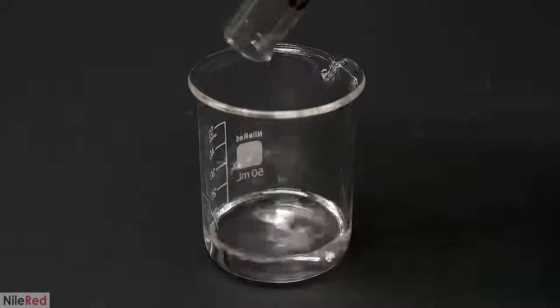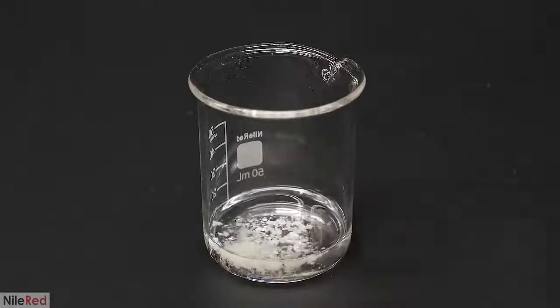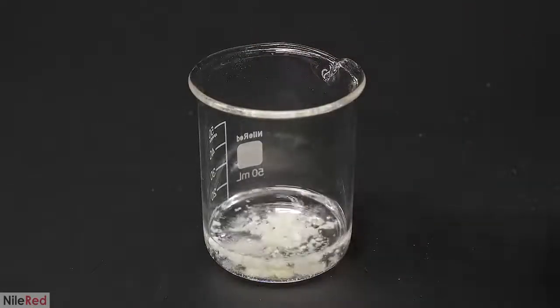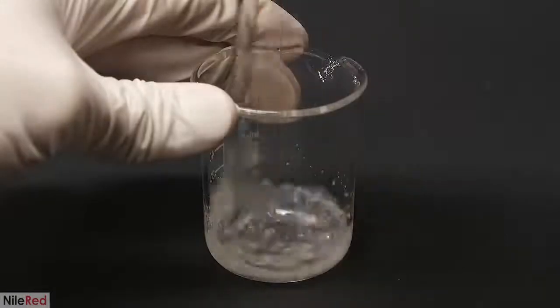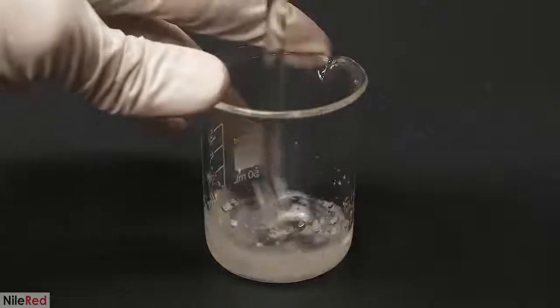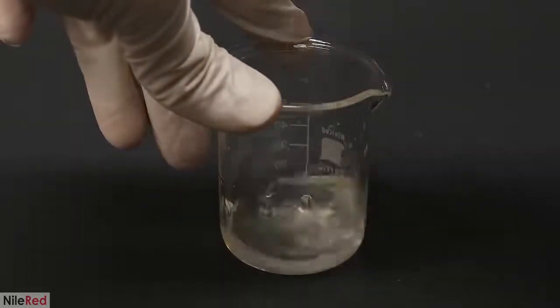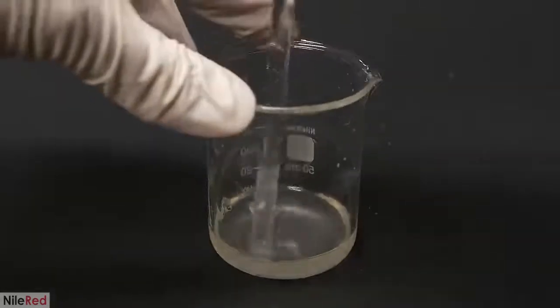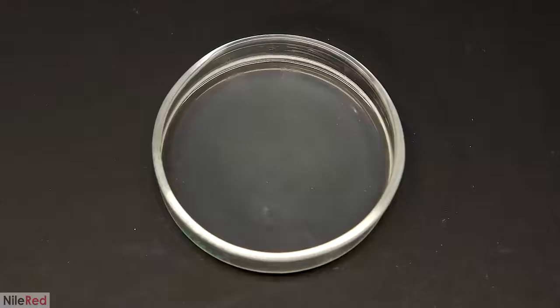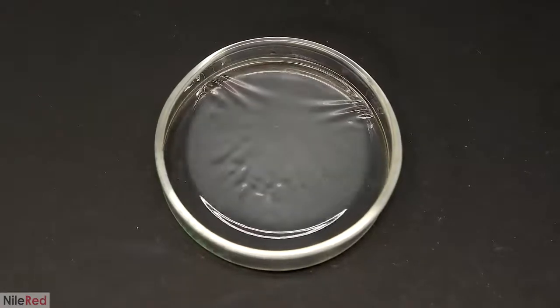Anyway, I moved on to trying the same things with the triacetate, except this time I can't use acetone. The triacetate isn't soluble in it, so instead I use a mixture of 9:1 DCM to methanol. I started with a bit more solvent than I needed here, so I just kept adding the triacetate until I got to a saturated solution. I poured it all into a glass dish, and this time I decided to do a time lapse.